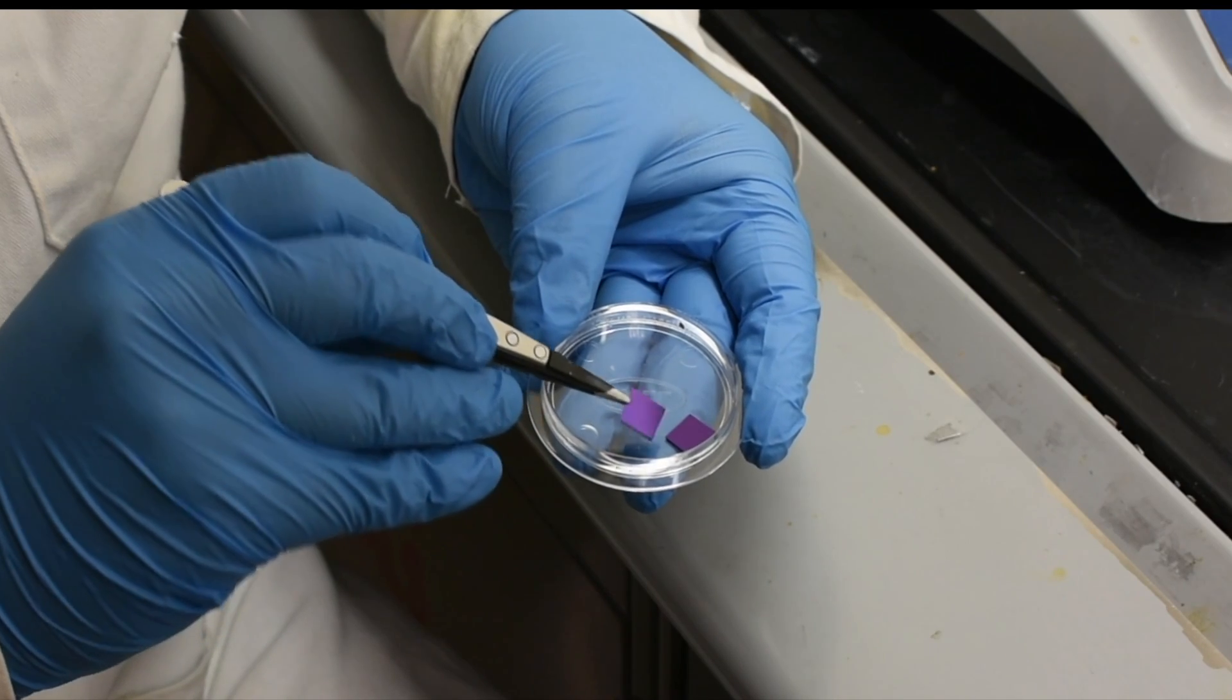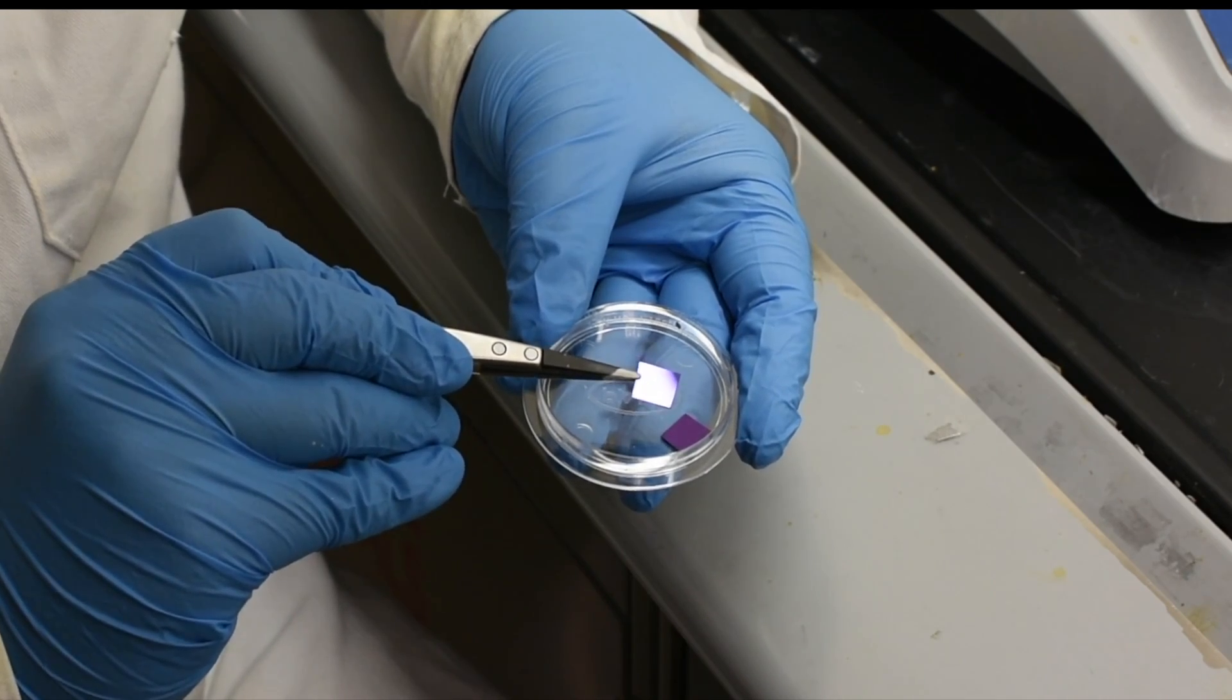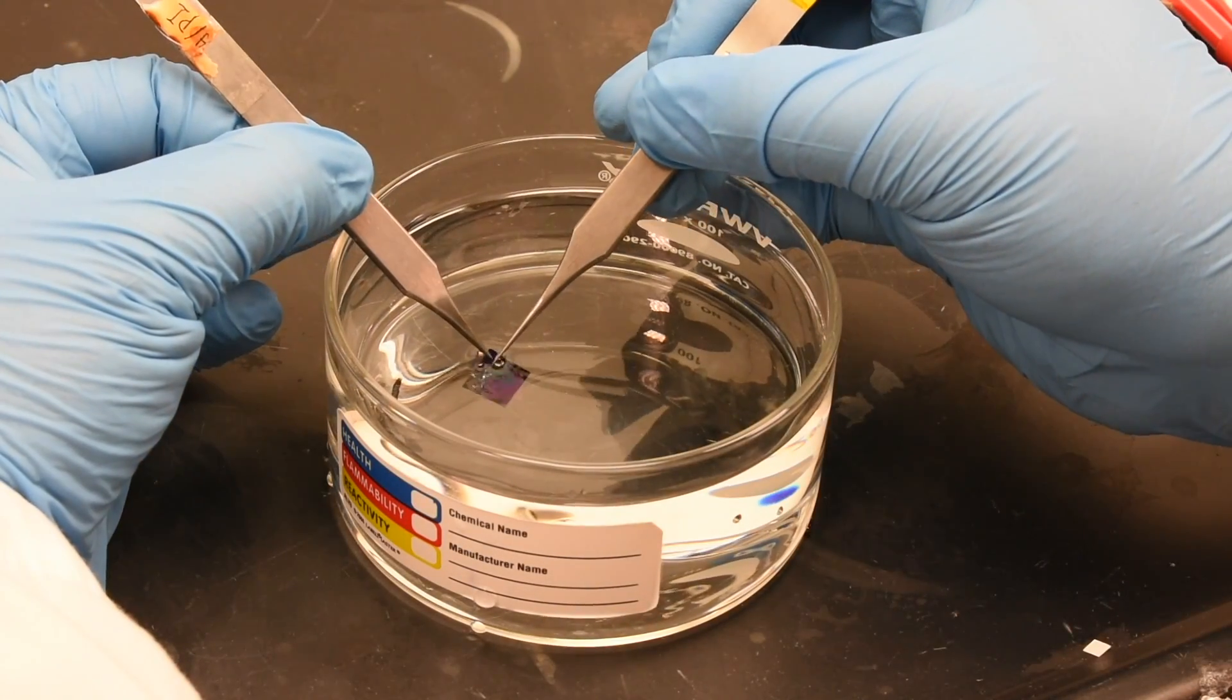For our sample in this video, we are transferring to a piece of silicon for our final substrate. Using two pairs of tweezers and our silicon substrate, we carefully fish out the films.